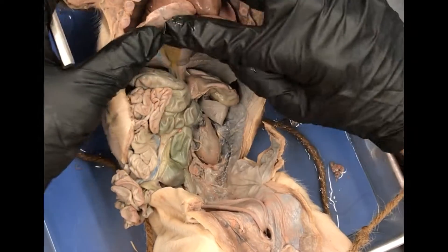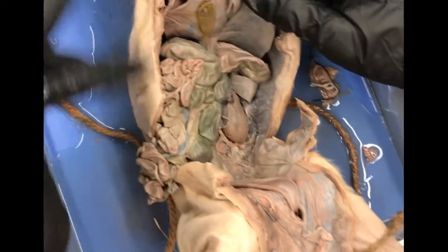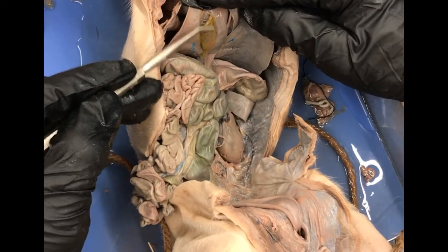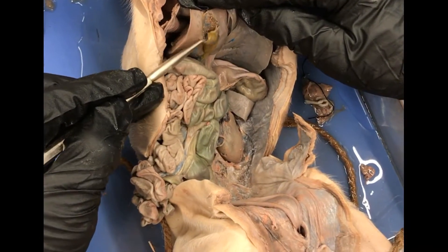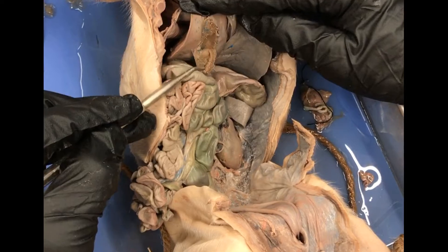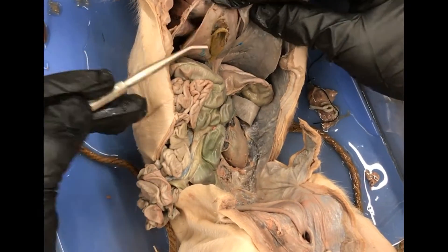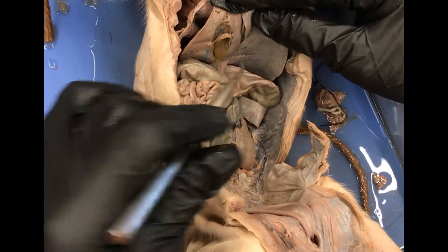If you pull the liver up like this, that's when you can see this green pouch that's kind of embedded in the liver — that's the gallbladder, right there.